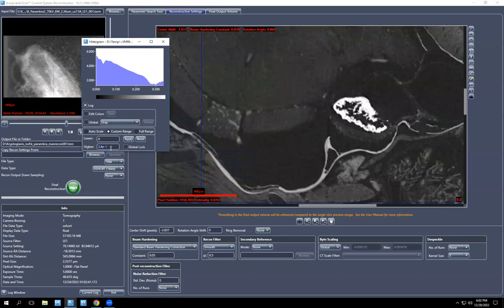I'm going to change it to 0.39, and then watch what happens not only to this but to the data. It scrunches in a bit, but you actually have detail in your otolith, which is what you want. So what changed? I'll do it again. Let's say 0.33, you'll see that this data gets stretched out, but you're actually losing stuff here. So let's try 0.39 again, and then you have gained that back. So what I did was 0.41.